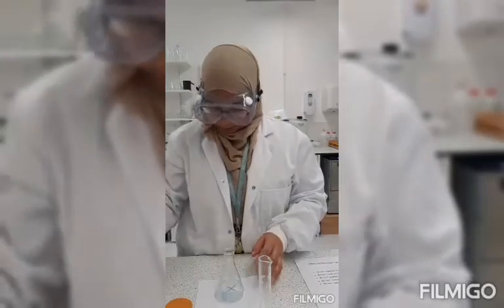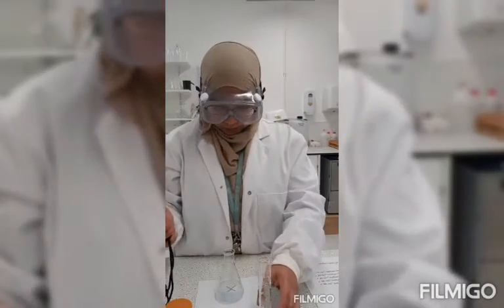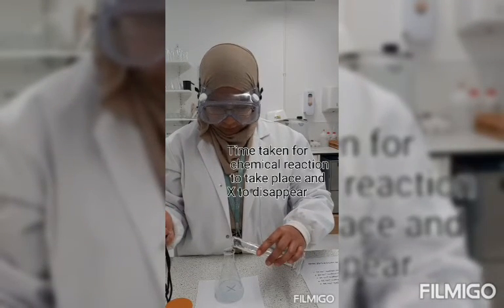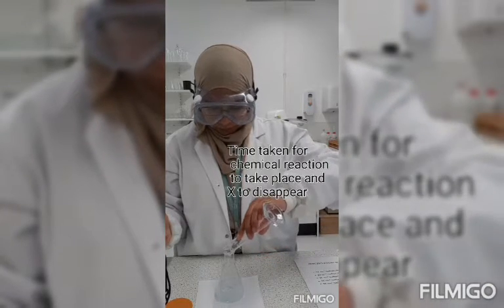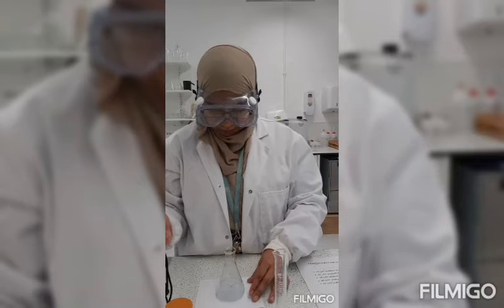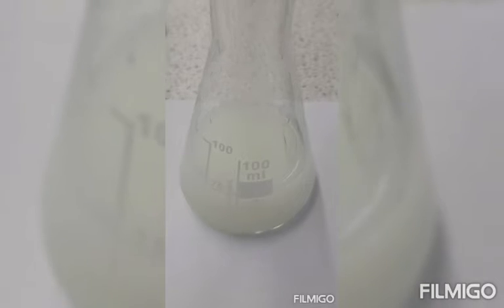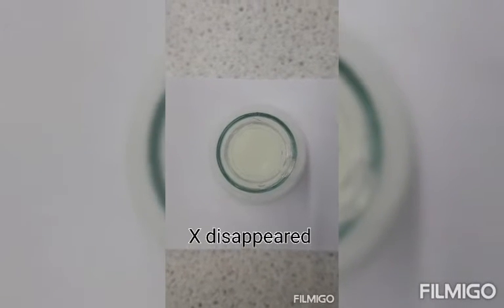Before I pour it in, I need to get my stopwatch ready. And as soon as I pour it in, I will measure the time and see how long it takes for the reaction to take place and the cross to disappear. So I've poured in my hydrochloric acid, give it a stir, and I can already see it going cloudy. It has gone cloudy and the X cannot be seen anymore.